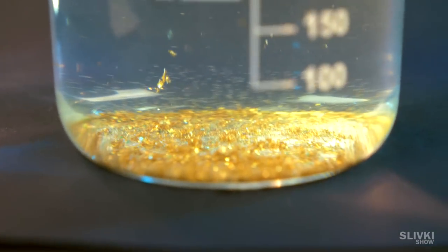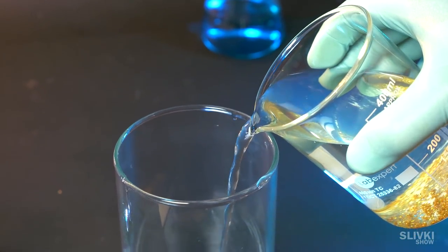When gold settled, we leaked water, so we don't need it anymore.